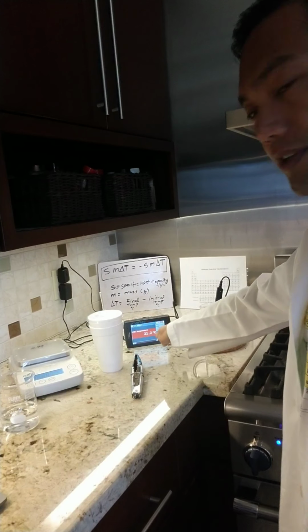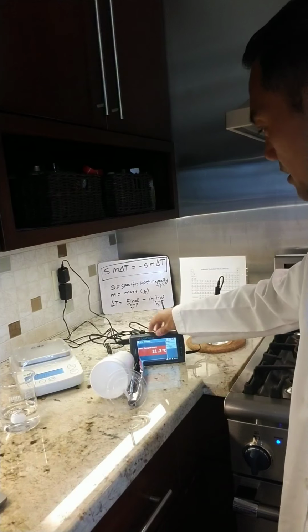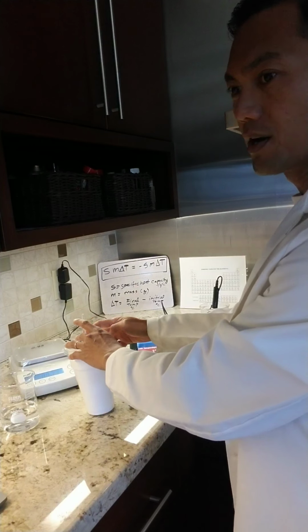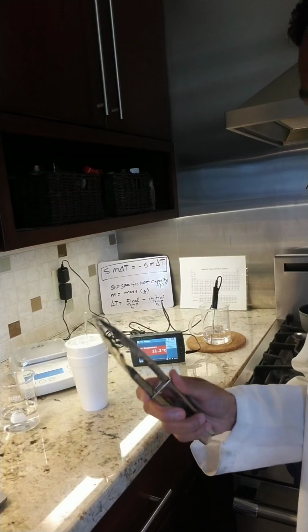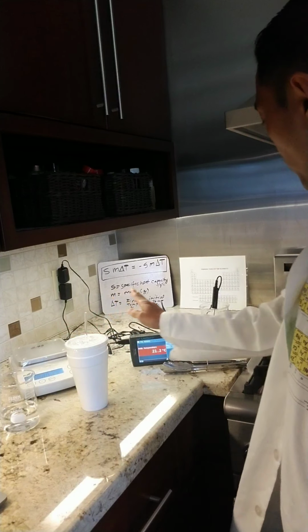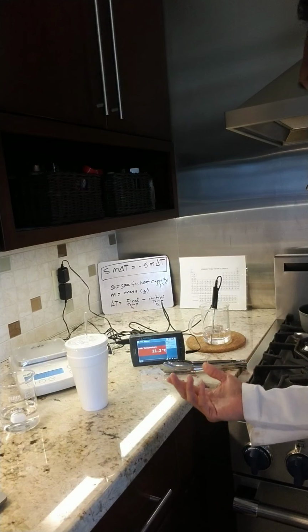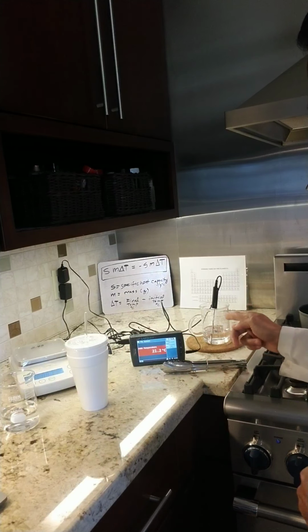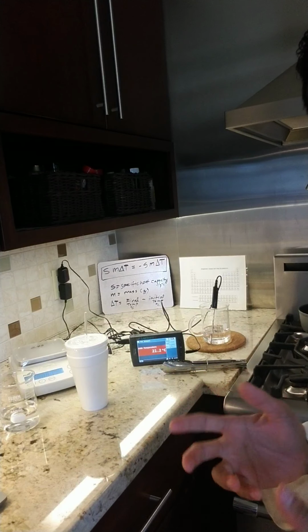Our thermometer is connected to our, let me move this closer, you can perhaps see that temperature. This is empty for now. And I just have regular tongs here. Our thermometer right now is measuring the initial temperature of our water. So the initial temperature, at least for the first metal we're going to test, is 21.2 degrees, and it's been sitting there for a while. I can't show you right now because part of this is the mystery of it.